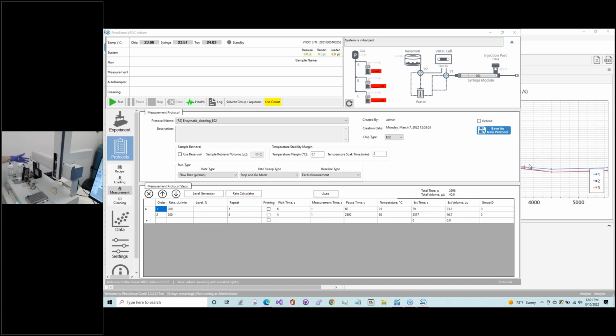So I would basically empty them out and either just reconnect them as empty bottles so you don't get dust getting into the ports here, or I don't know if they come with the kit, but we can provide plugs that can plug up these ports if that's going to be an issue for you if you do have a lot of downtime. So yeah, I agree, an empty bottle would be better than the PBS there, and just sacrifice that fluid.